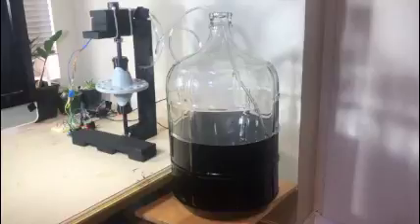Our sensor works by extracting fluid samples from a fermenter or bioreactor, as represented by the carboy to the right, and continuously measuring the ATP in those samples. When graphed over time, these measurements can be characterized as either contaminated or not based on a classifier that we trained on a dataset we built in-house.